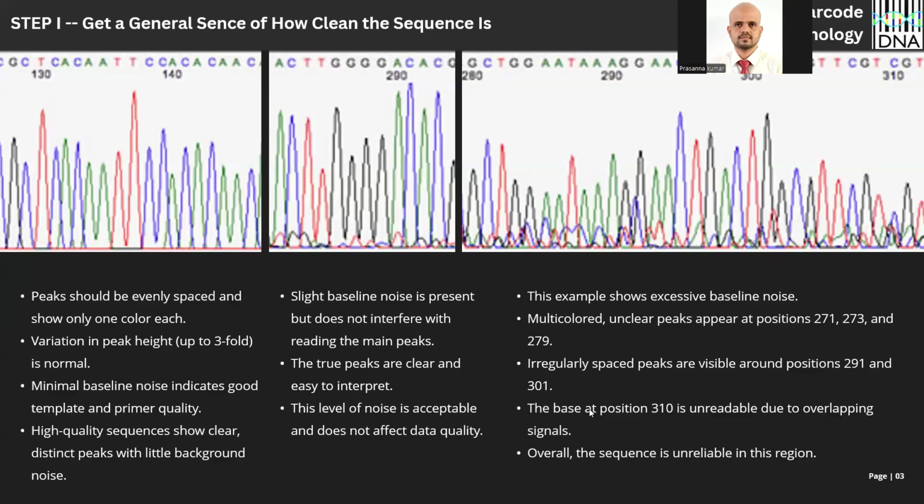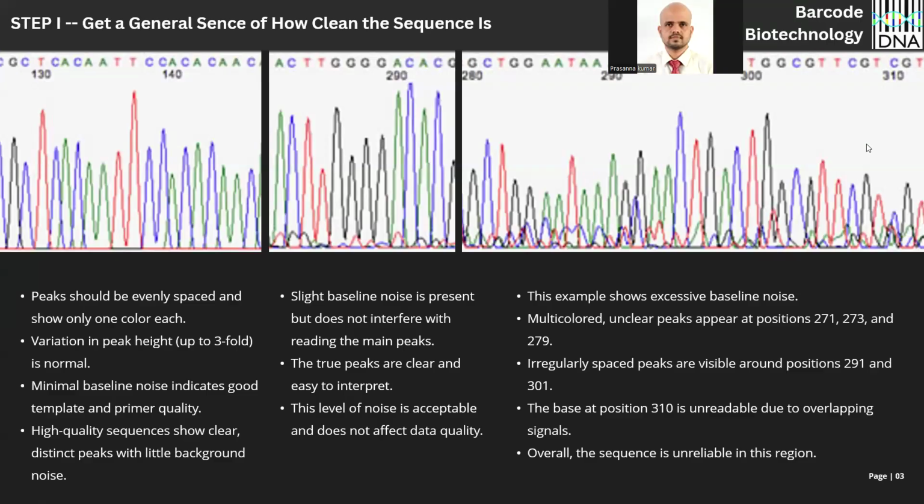And also the base at position 310 is unreadable. Here, see, better call it as N. Do you remember during our first class we spoke about IUPAC codes? In IUPAC codes, we also have N. Whenever a software couldn't call a particular position, better call it as N. But see, here the software boldly called it a cytosine, which may not be the actual case.